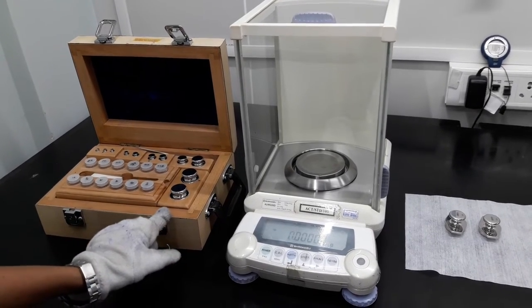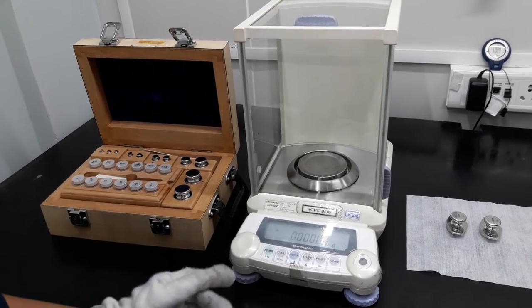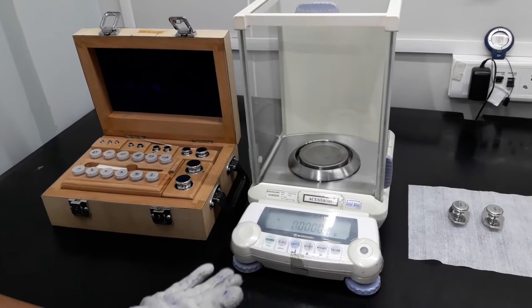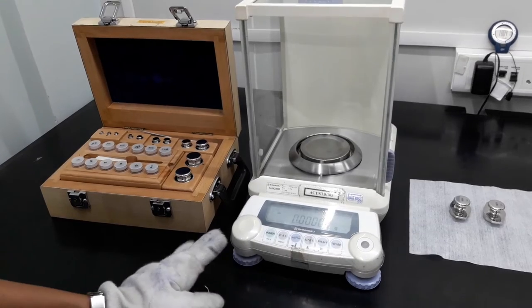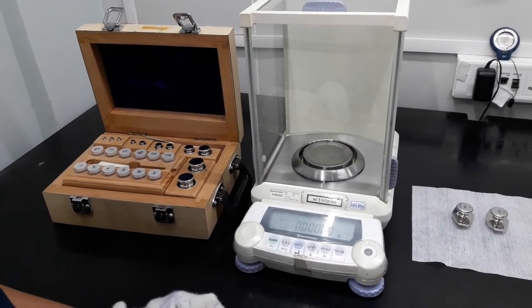Before starting the actual procedure, 30 minutes warm-up period should be given to the weighing balance and for weights, that is both UUC and the reference weight. A soaking period of 30 minutes has to be given.